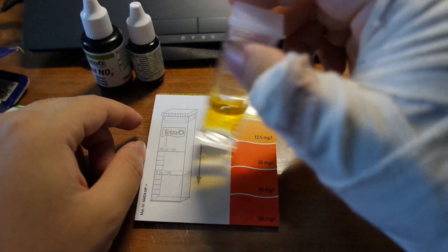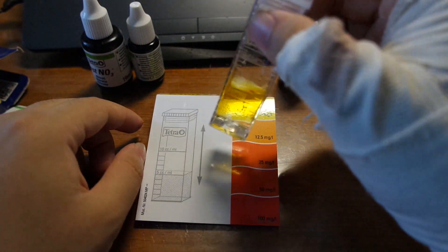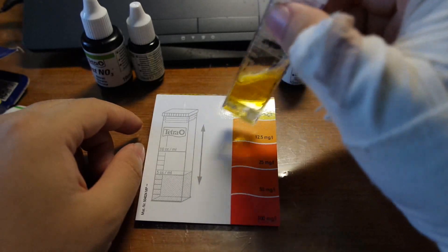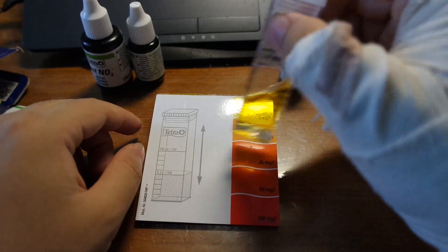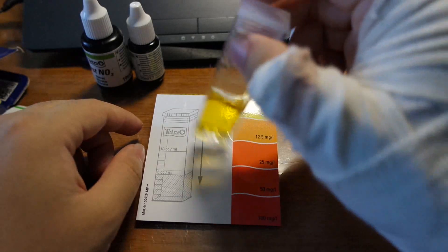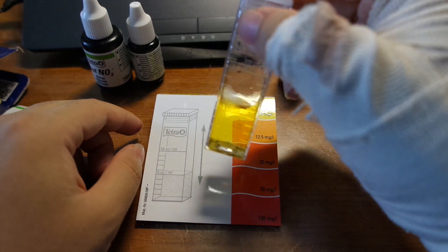Basically you just wait for like 10, the kit says 10 minutes but I have never seen the color change beyond like 1 or 2 minutes. After 1 or 2 minutes the reaction is pretty much done and I don't see it change anymore. But I will give it 10 minutes so I will do what the kit says. We will be back in 10 minutes to see if the color has changed.